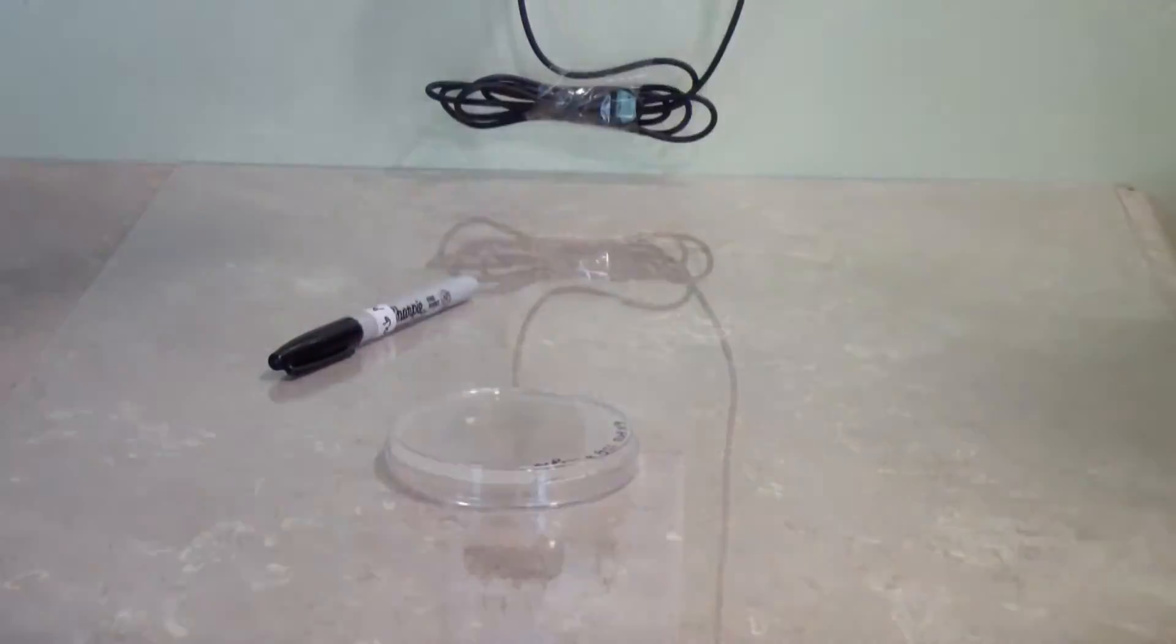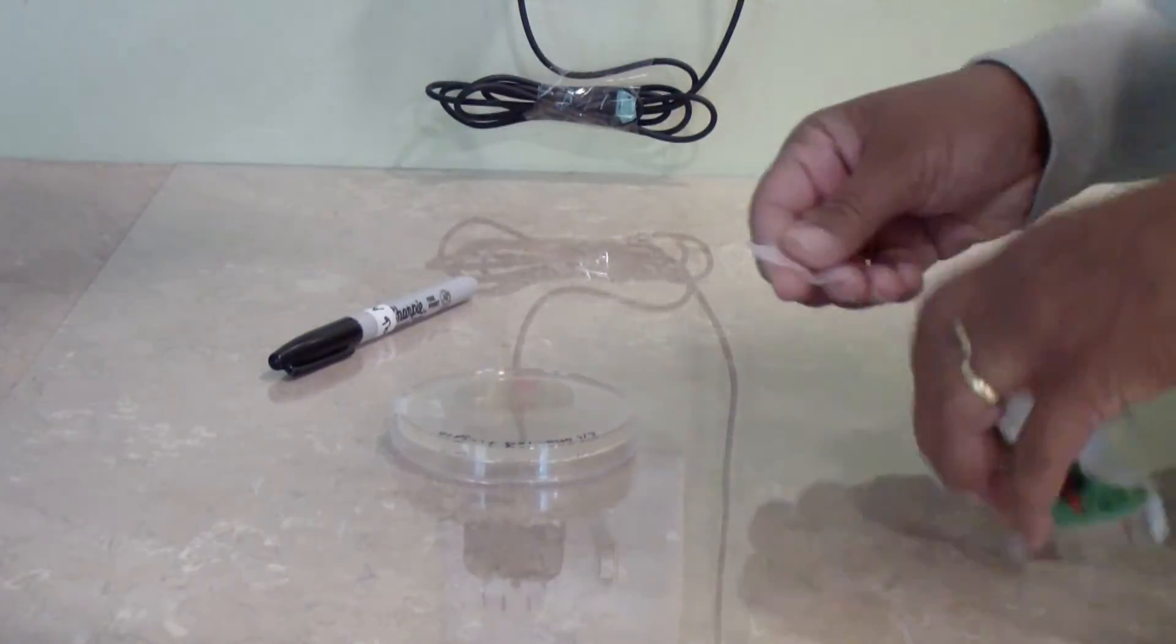Discard the cotton swab in your household waste container. In this case, I highly recommend that you tape the lid to the bottom of the plate.